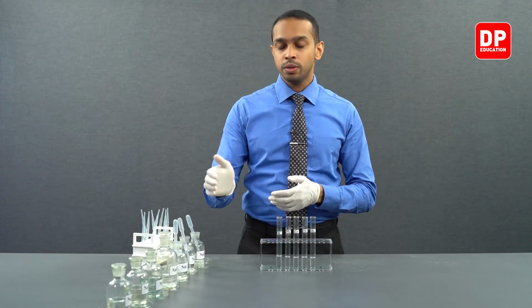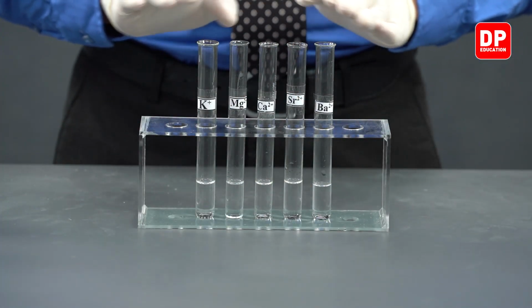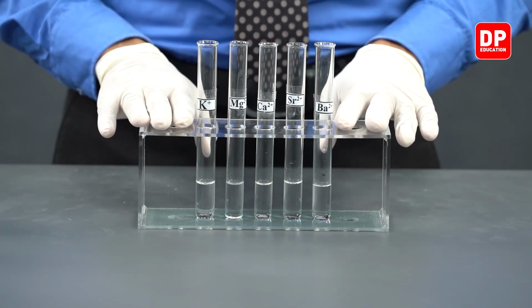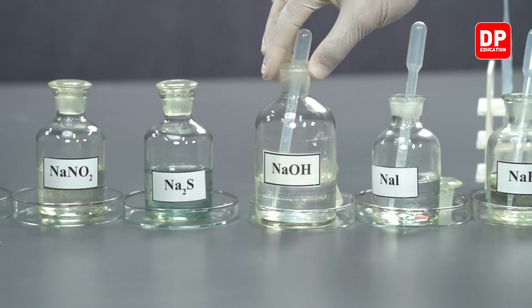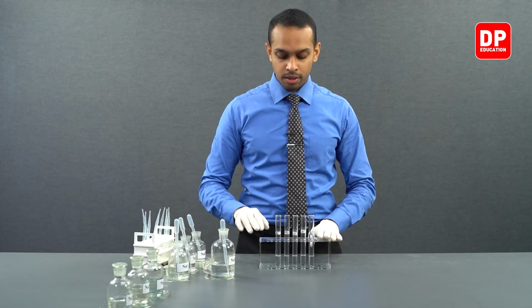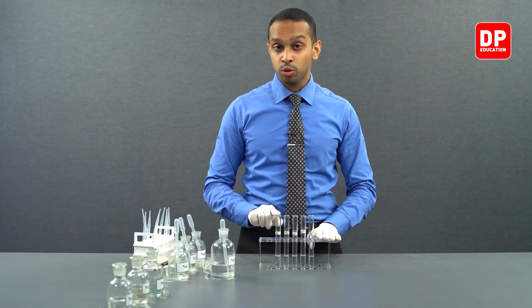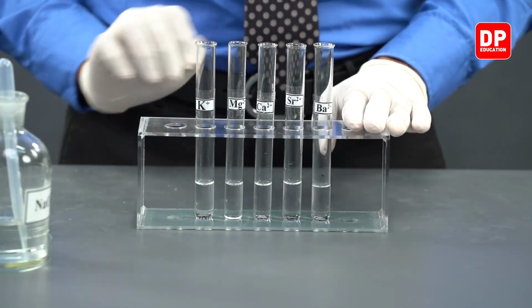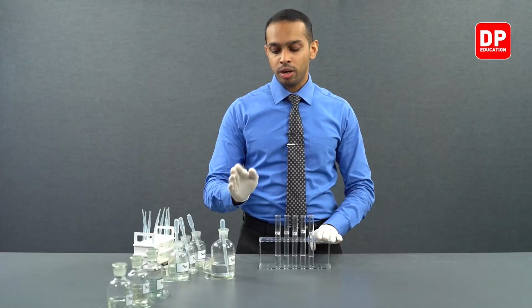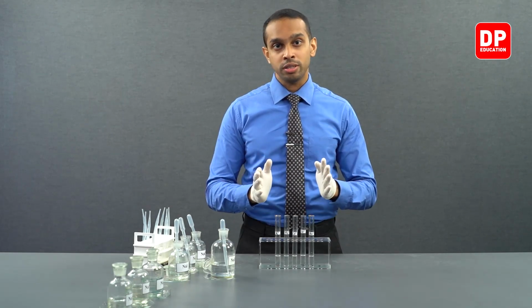Let's move on to sodium hydroxide. We have here new portions of all of the cation solutions taken into 5 different test tubes. And to these test tubes, we will be adding sodium hydroxide. So, when you add sodium hydroxide, you will notice that the group 1 cations do not form any precipitates. All of the group 1 cations, when reacted with hydroxide anion, will form soluble salts.